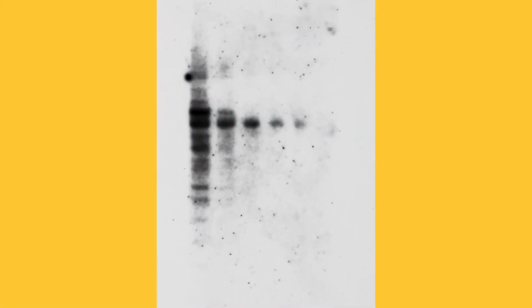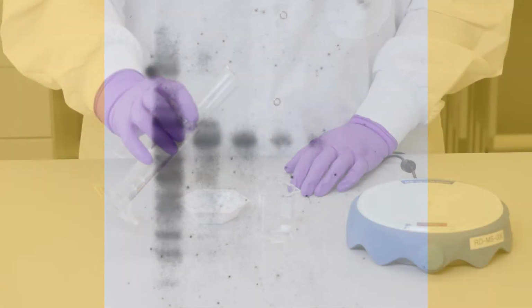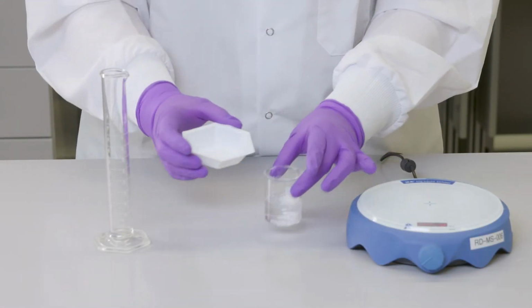The milk needs to be completely dissolved to prevent speckling on the transfer membrane. This can be done by stirring the solution for 10 to 15 minutes.